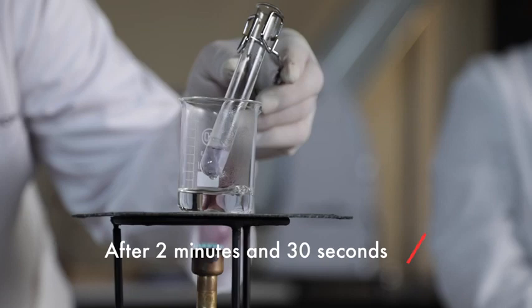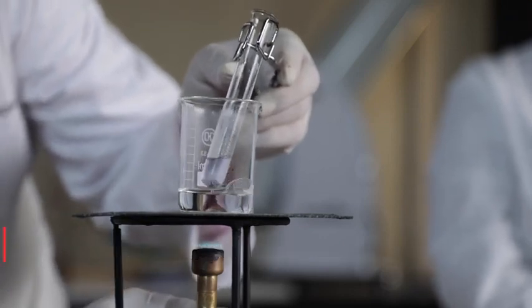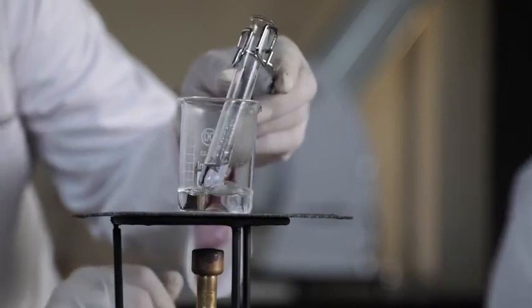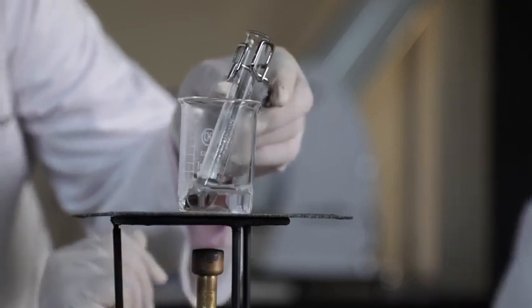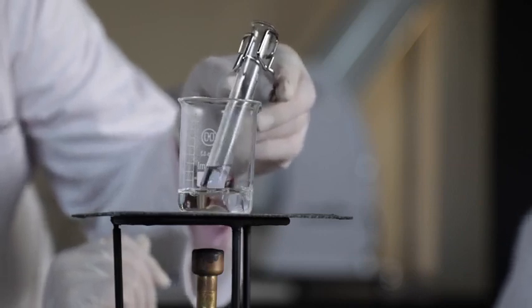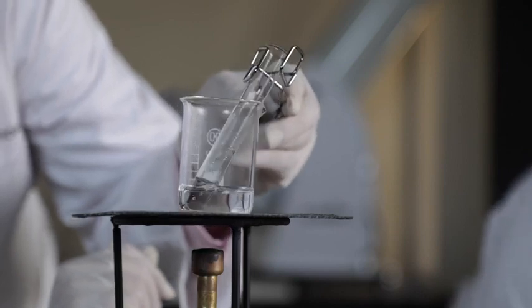Okay, the water's starting to boil. So we're going to turn off the Bunsen burner, but we're going to keep the reaction mixture in the hot water. And watch it carefully so it doesn't overboil.